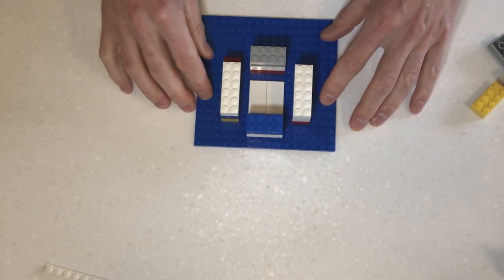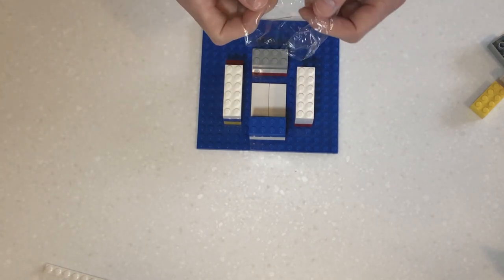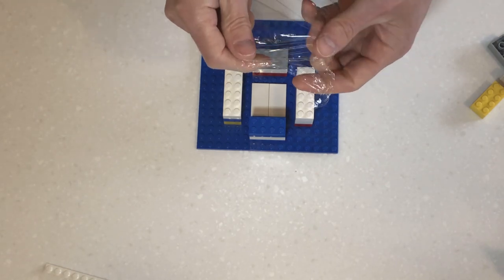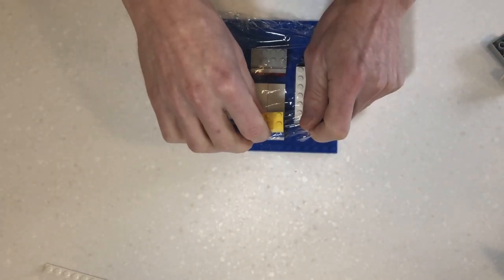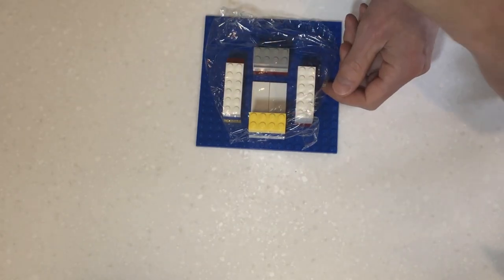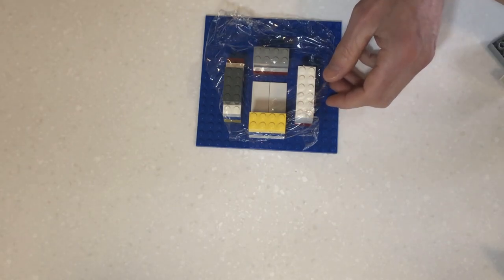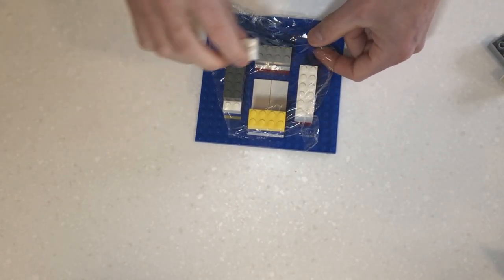Okay, now comes the tricky part. So I'm gonna take my cling film. Now cling film, by its very nature, is very clingy. What we're trying to do is to keep it as flat as possible. And we're gonna use our Lego here to anchor the cling film in place. So as you're moving around here, try and pull it as tight as possible.